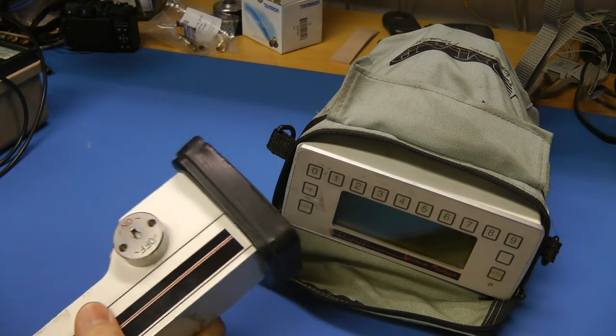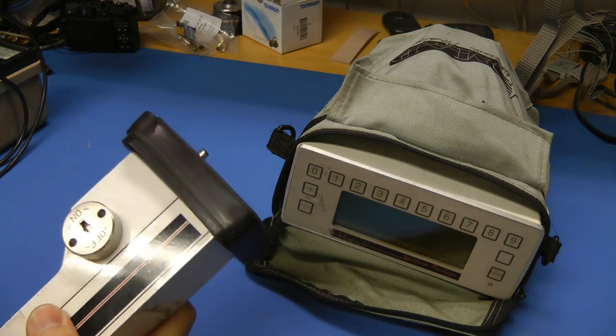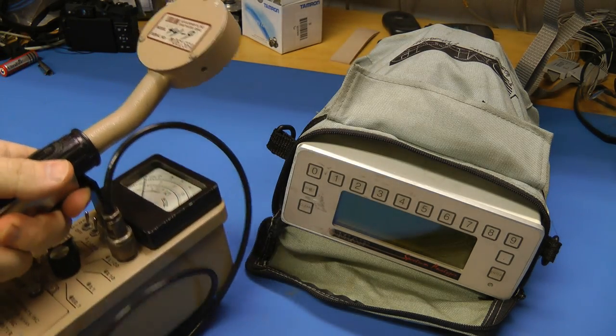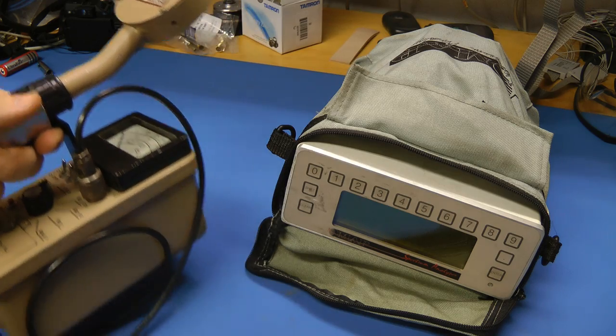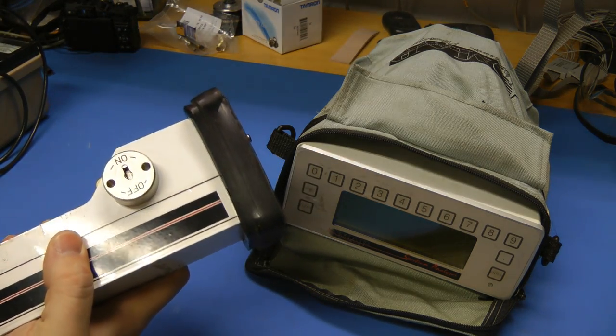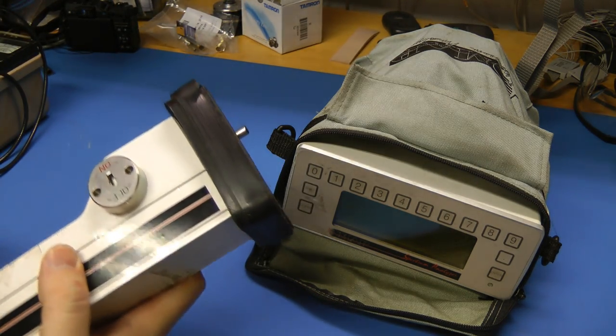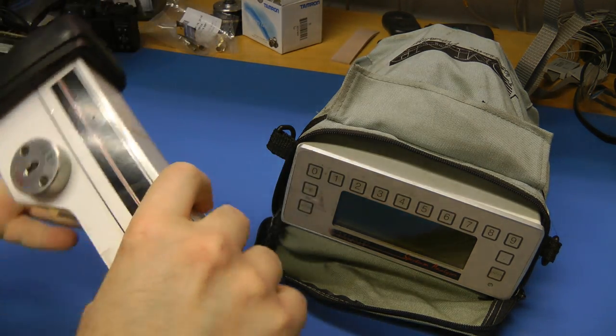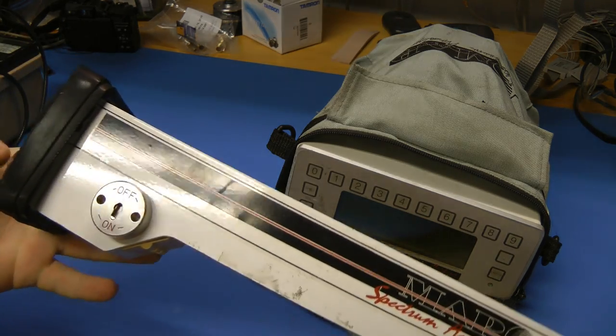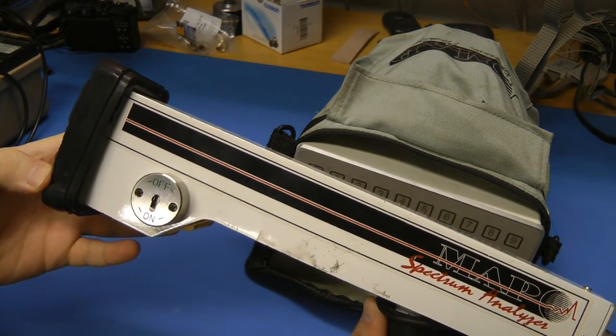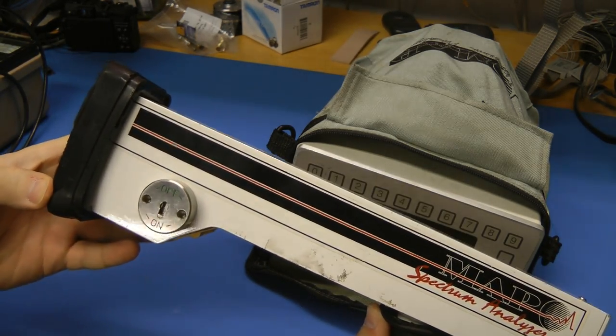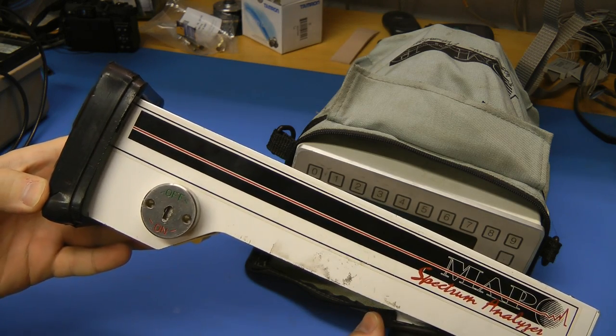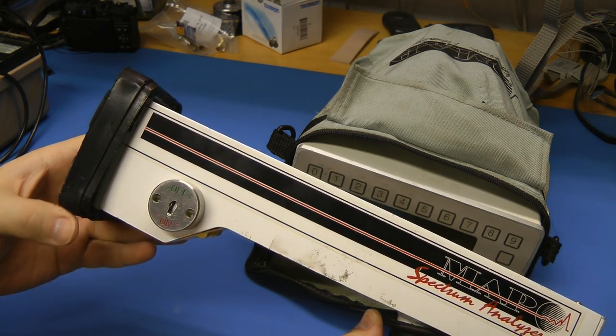But I'm not comfortable tearing this down until I got access to a Geiger counter. Because this thing can have, from the documentation I read, it can have three different radioisotope sources: Cobalt-57, americium-241, and cadmium-109.